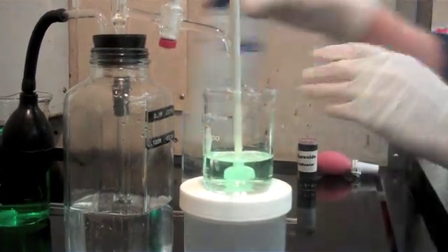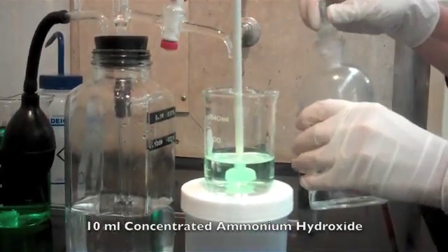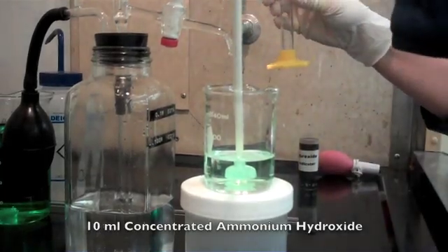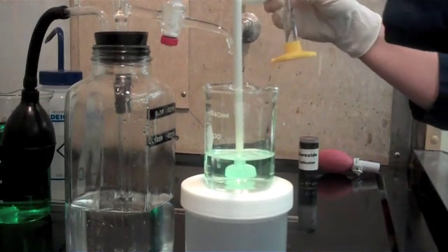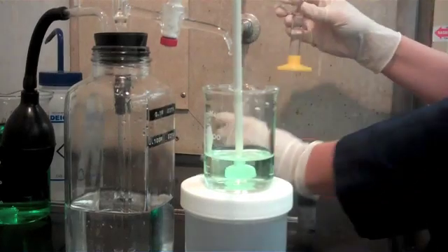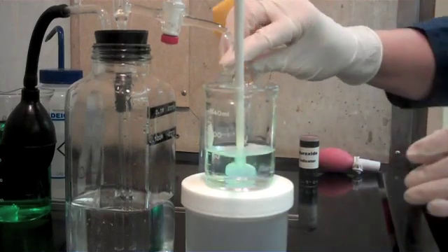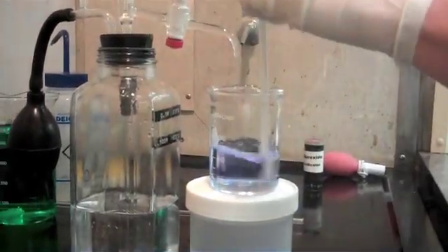After adding the water we're going to add 10 mils of concentrated ammonium hydroxide using a graduated cylinder to measure the ammonium hydroxide, not as critical as the sample itself so a graduated cylinder is fine. When we add the ammonium hydroxide we have a nice purple color as the nickel is complexed with the ammonium hydroxide.